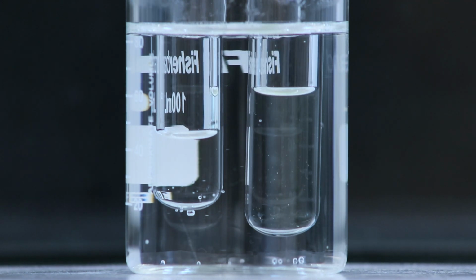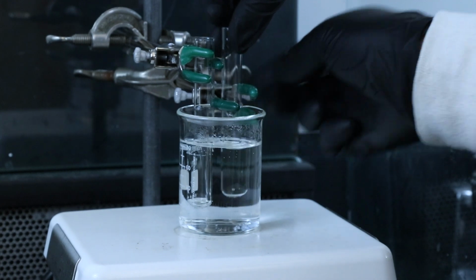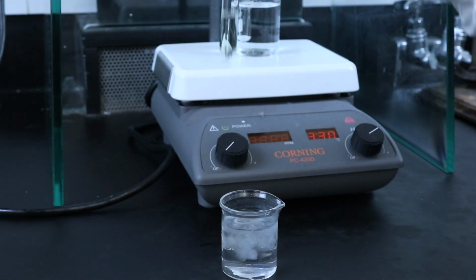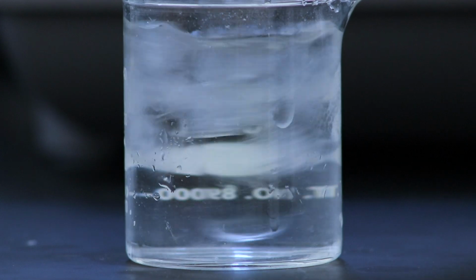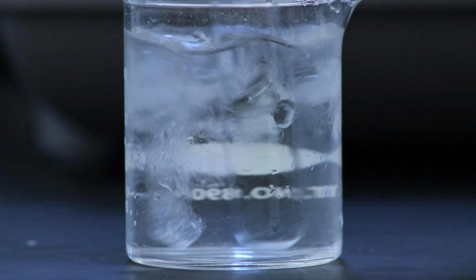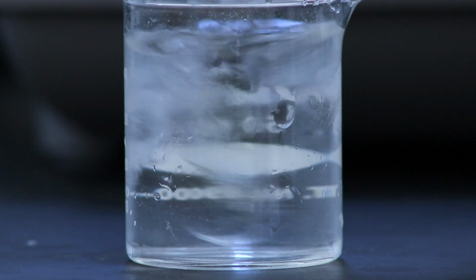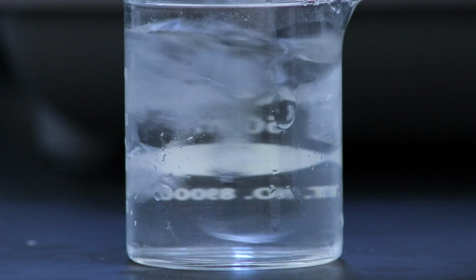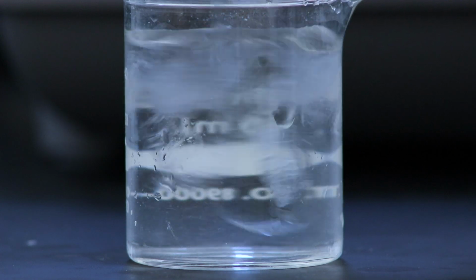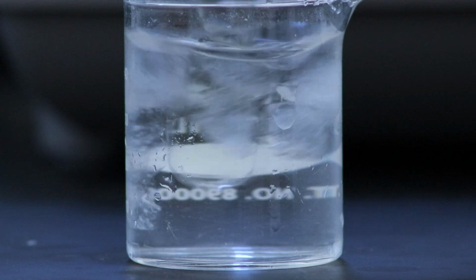Once the solid is dissolved, you can take the test tube out of the hot water bath and transfer it over to an ice bath to test if the product can come out of that solution. You can stir the test tube in the ice bath to help it cool down, but if after a few minutes no solid crashes out of solution, then you've probably added too much solvent and should evaporate some off so that the product can come out.